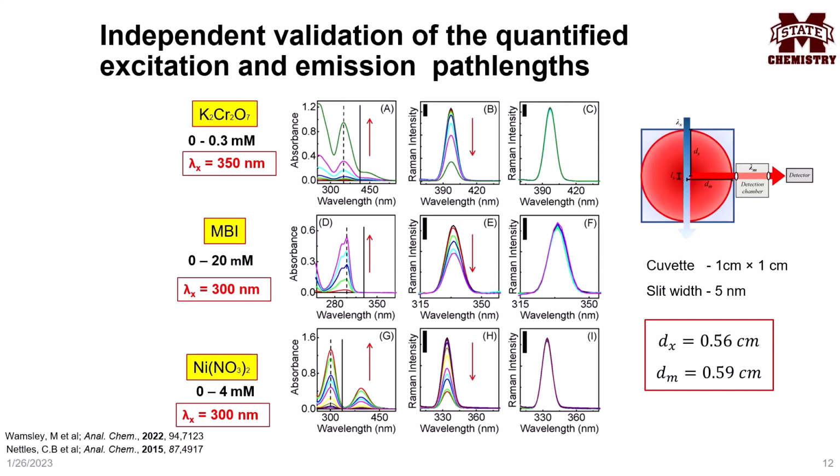Independent validation of these effective path lengths for correcting the Raman signal is shown using the following chromophores. As can be seen, this validation is done using concentrations different from the ones used in the previous slide. Figures A, D and G show the concentration-dependent UV-vis spectra of these chromophores, and B, E and H show the corresponding Raman spectra. Again, the arrows point in the direction of increasing chromophore concentration.